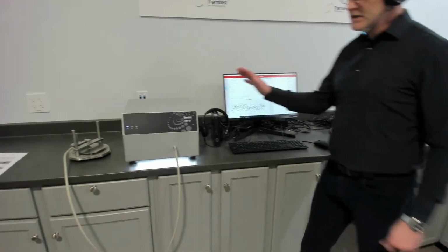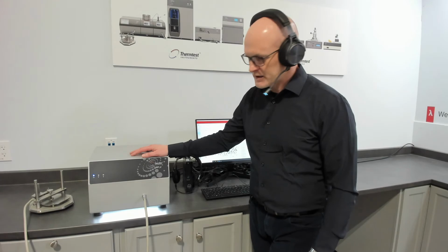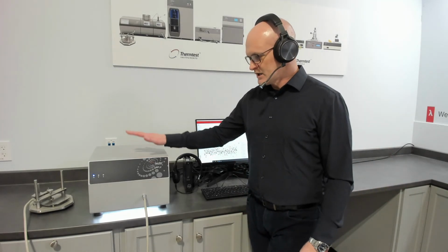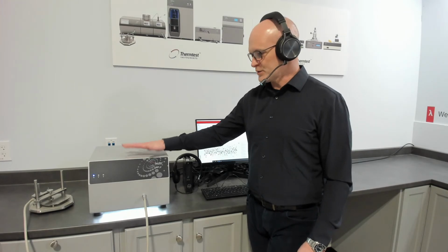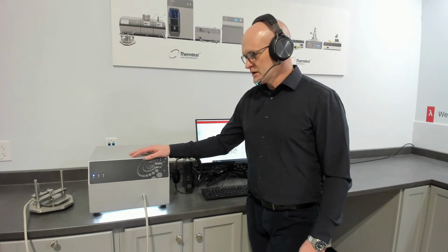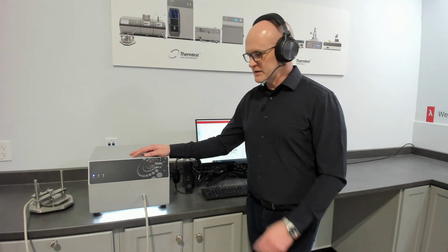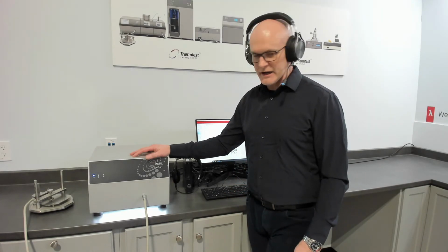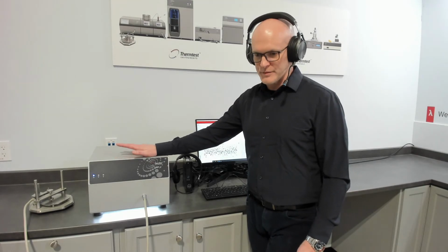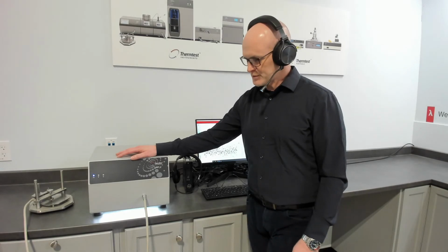Our MPV is our mid-range measurement platform. It incorporates 2 primary methods, just like our other measurement platforms. Transient plane source for thermophysical properties of solids, pastes, and powders. Transient hot wire for thermophysical properties of liquids. So it's really the 2 primary methods that are used for measuring accurate thermophysical properties. Being our mid-range, it is our most popular model, as that mid-range does cover the bulk of the applications.